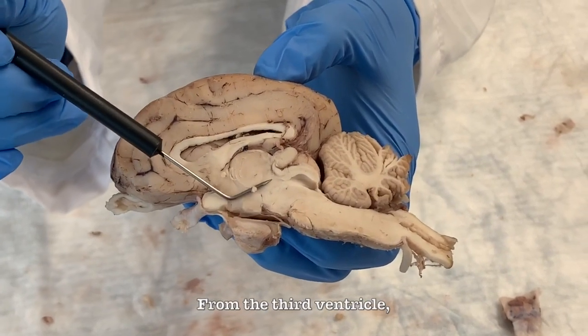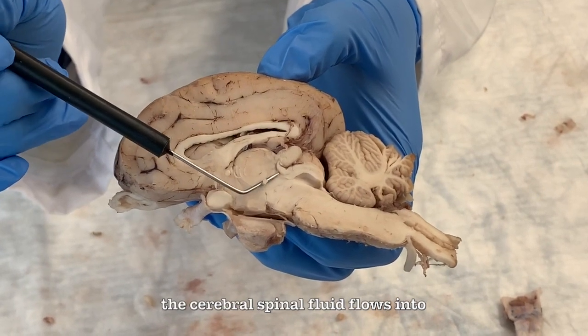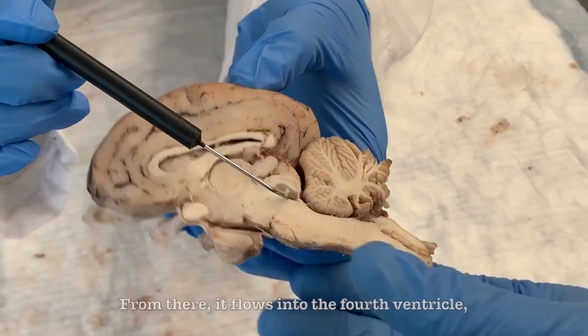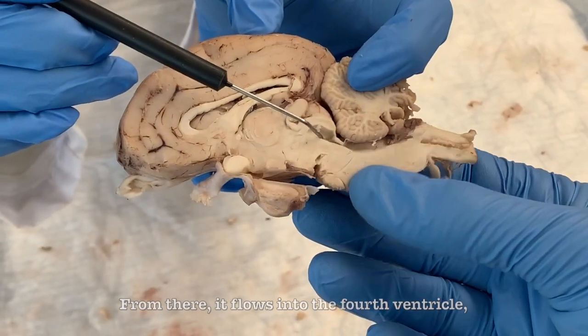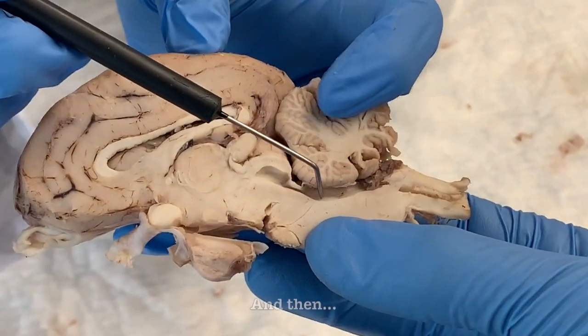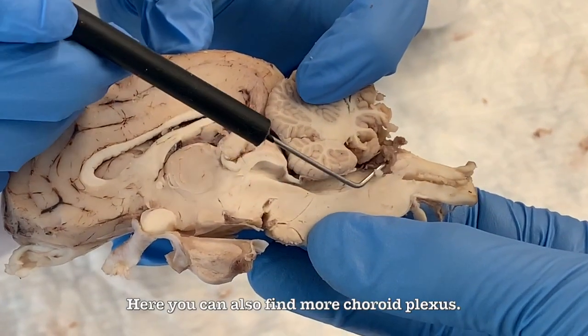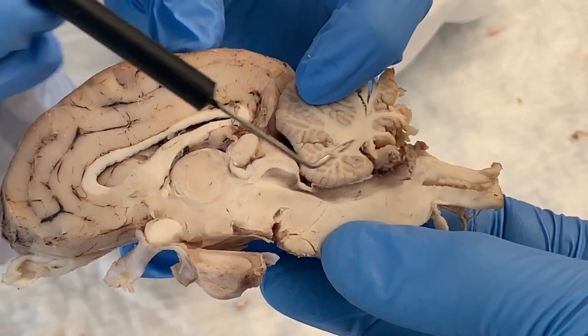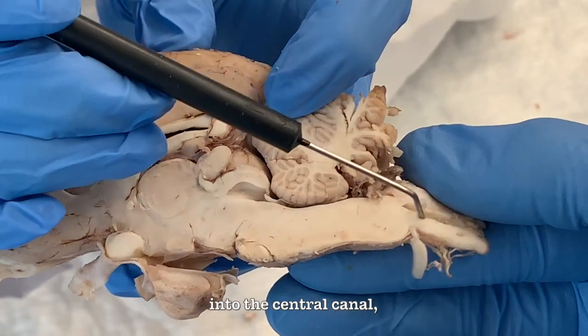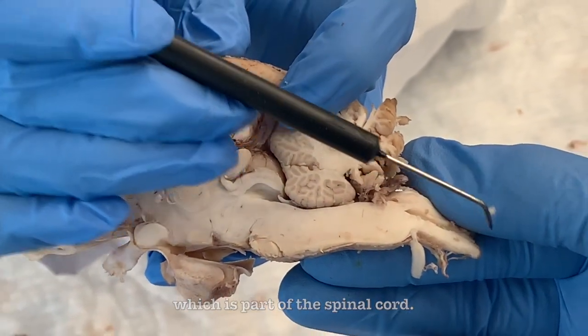From the third ventricle, the cerebrospinal fluid flows into the cerebral aqueduct, which is the ridge you can see right here. From there, it flows into the fourth ventricle, which is the space between the cerebellum and the brainstem. And then here you can also find more choroid plexus. From the fourth ventricle, the cerebrospinal fluid flows into the central canal, which is part of the spinal cord.